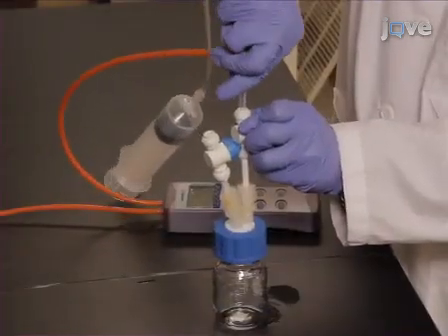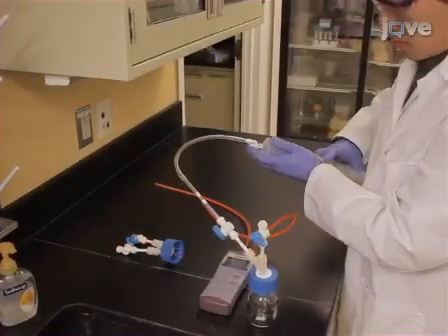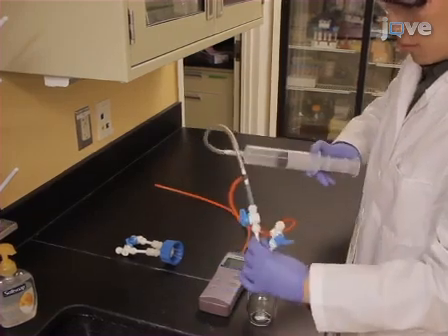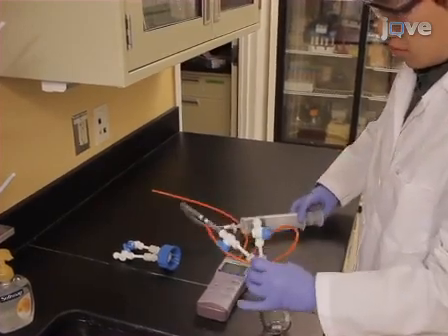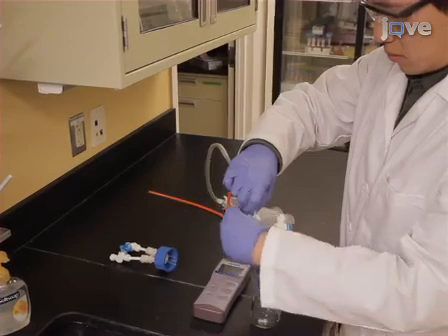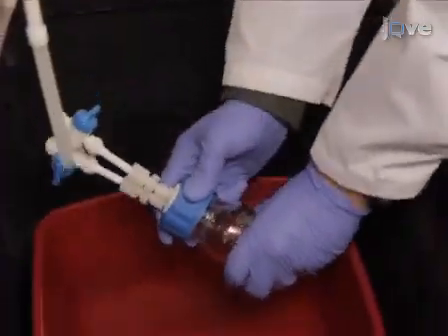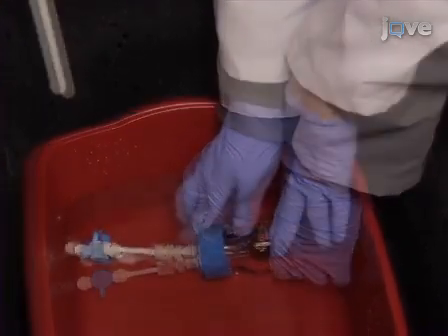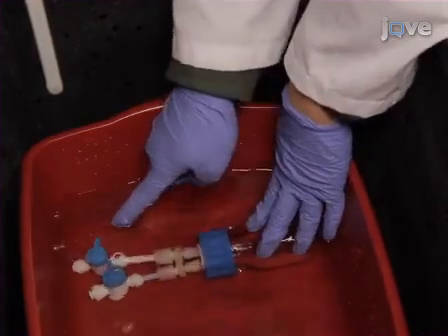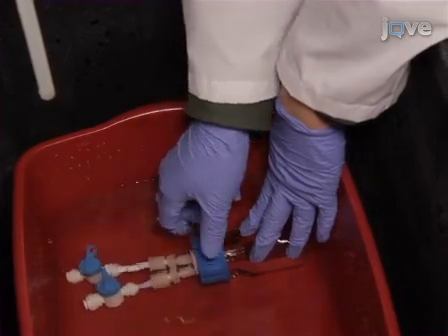Prior to culturing your samples, pressurize the vessels and submerge in water to check for leaks. Gas leaks are a primary cause of atypical results in the form of weak or absent volatile ion signals.